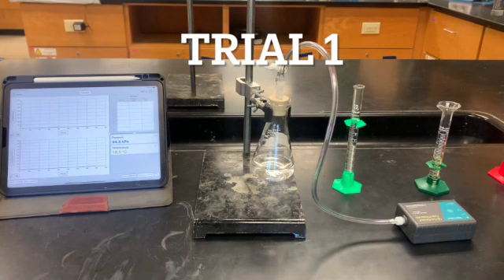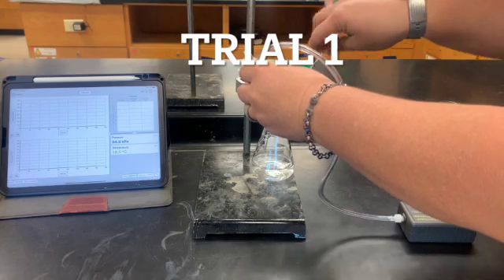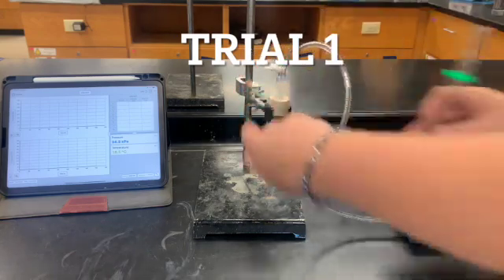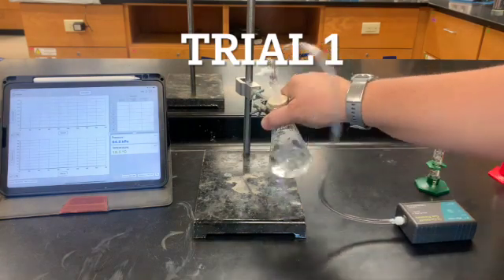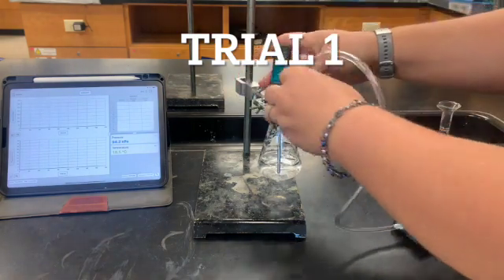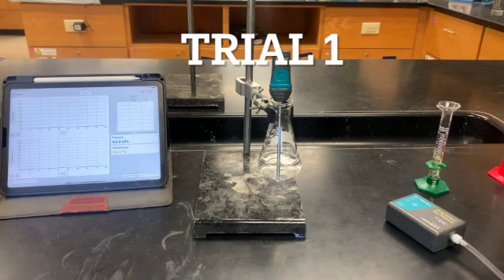Okay, I've measured out exactly 10 milliliters of the 3% hydrogen peroxide, and I'm going to place it in the flask as well. Now for me, this might be a little bit colder because I brought it out of the fridge. All right, we're going to shake it just a little bit, make sure it gets all mixed. And then I'm going to put it back in there, and get my starting temperature again of what I'm starting with.